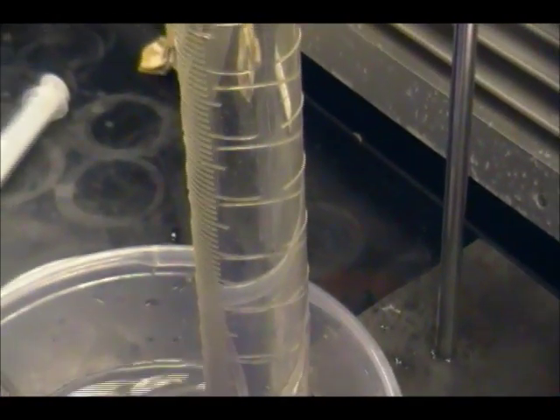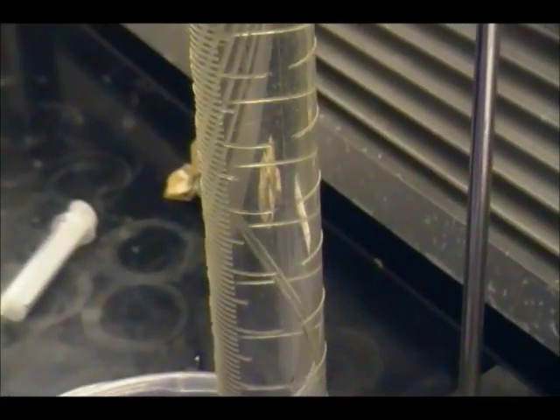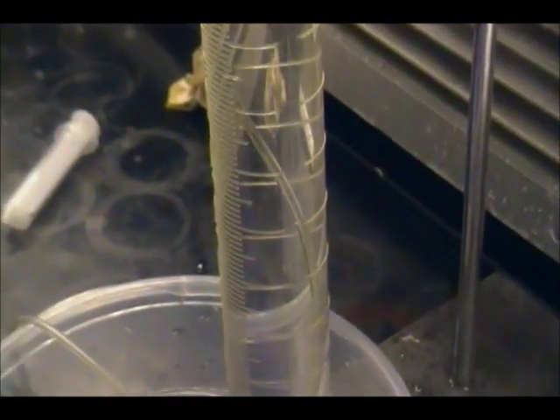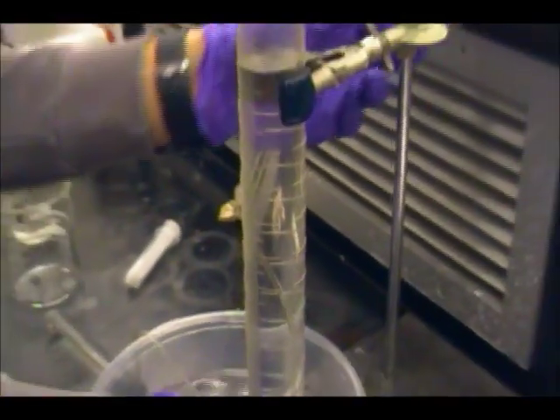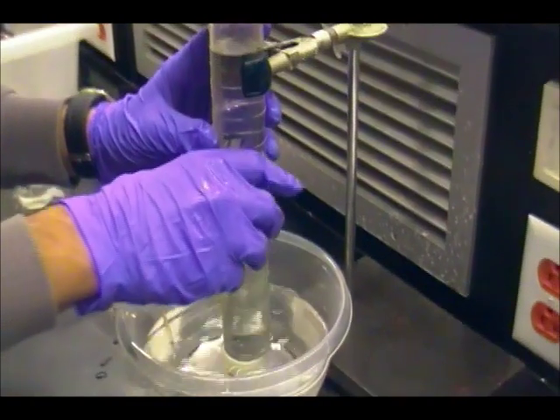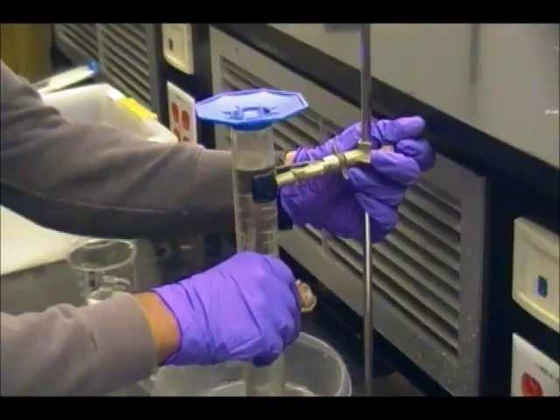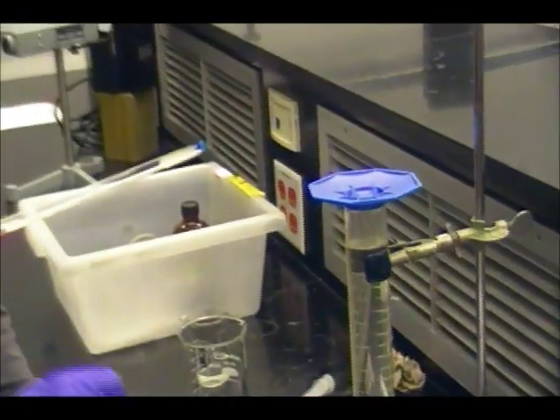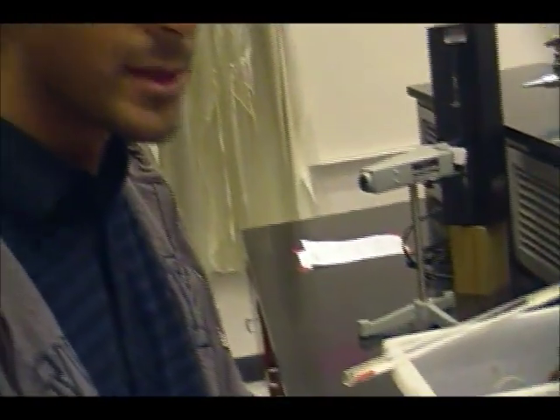Okay, that's well above 2 inches, and we need to make sure that the hose is pinned down to the bottom of the container so it doesn't slip out while we're doing our experiment. So we're going to lower it and have it pinned down right there, and then tighten this back up. We want to pin the hose at the bottom of the container because that ensures that the hose will stay in the graduated cylinder. If the hose ever slips out of the graduated cylinder, then you can lose hydrogen gas bubbles to the surroundings, and that'll make all your measurements inaccurate, so you'd have to repeat the trial over again.